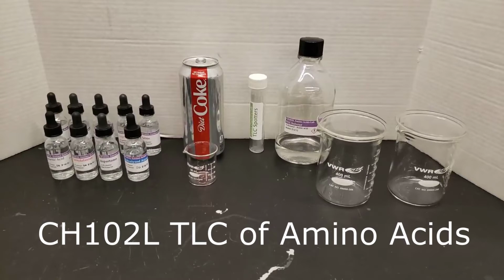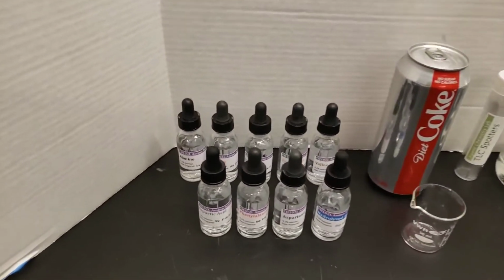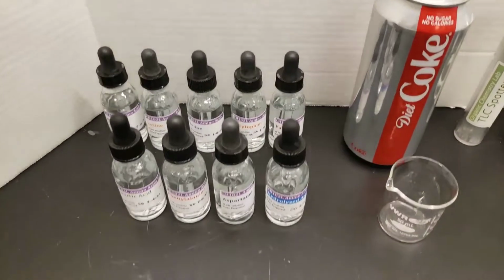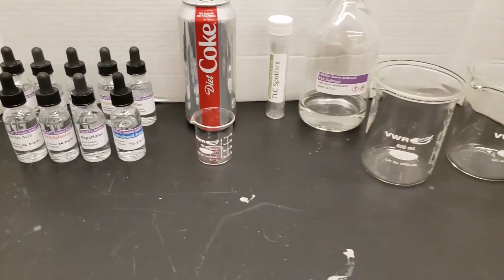Hello! Today we have a TLC lab for you. And here we have all the things we're going to use. First we have little dropper bottles with all sorts of amino acids, a can of Diet Coke, and some TLC solvent.